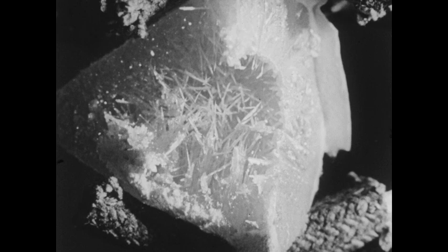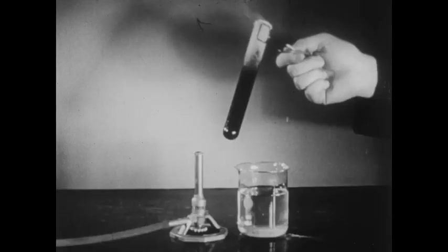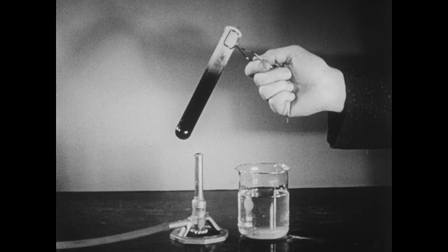This form of sulfur — the monoclinic form that you see — is only temporarily stable at room temperatures and will eventually change to the rhombic form. It's easily identified, however, by means of the characteristic needle-like appearance of the crystals.